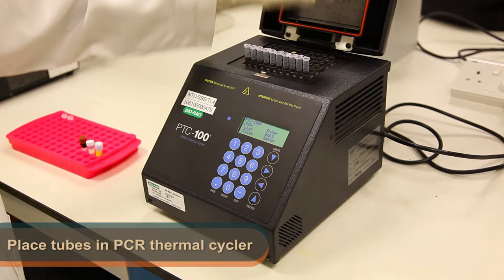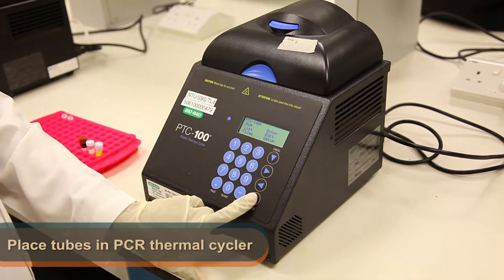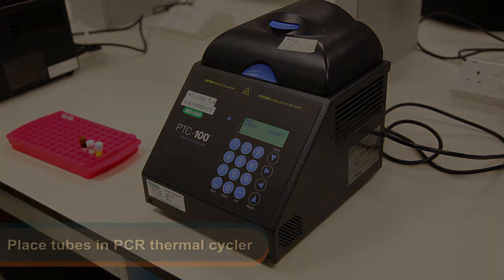Next, place the tubes in the thermal cycler and the TA will run the program. At the end of the reaction, the tubes will be stored for the next part of the experiment.